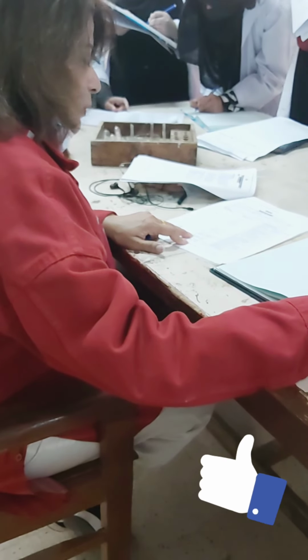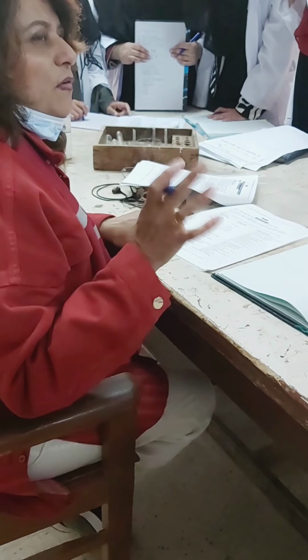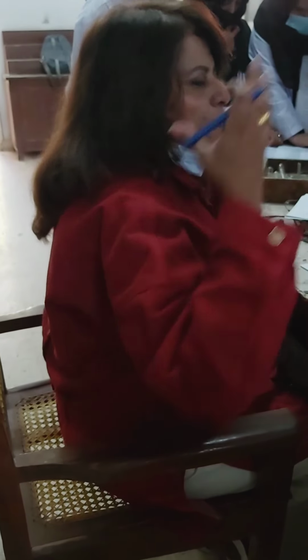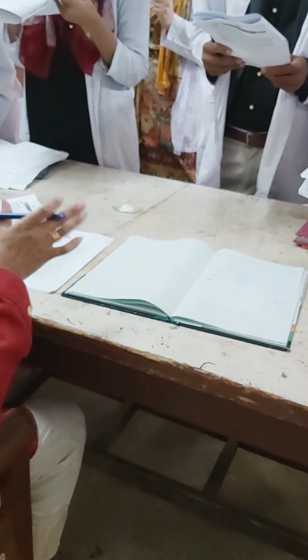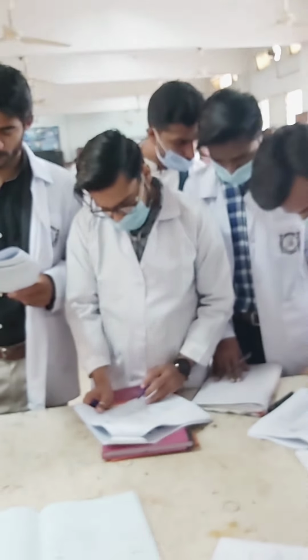There is not that much irritation, but yes, a little bit. Bitter almond is only for the benzaldehyde compound, the compound that has bitter almonds, kadve badam. Only chloro compounds will make your eyes full of tears, with a lot of water coming out from your eyes. That is an indication of a chloro compound, right? But it doesn't have a fishy smell. It doesn't have a pleasant smell either, but it has no smell.